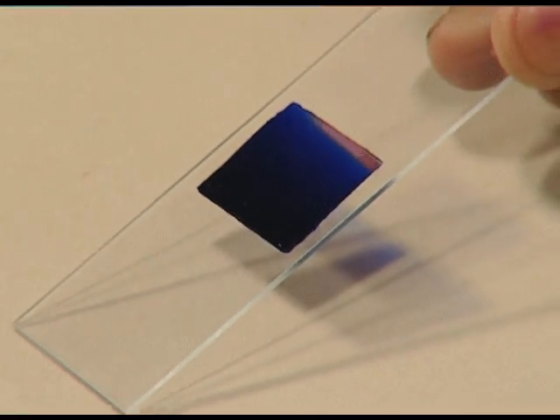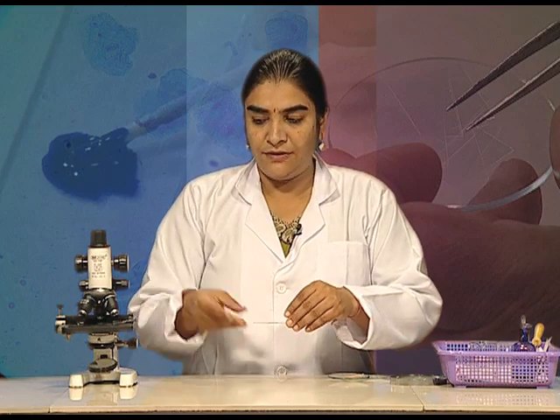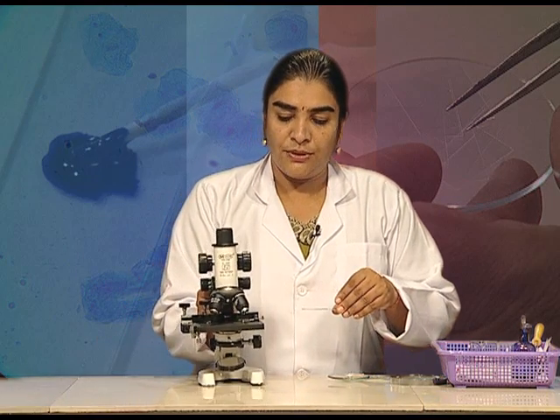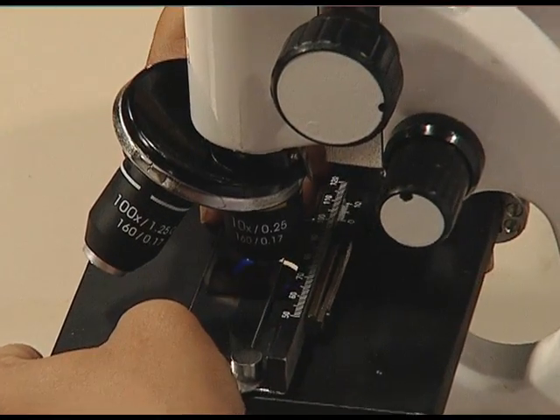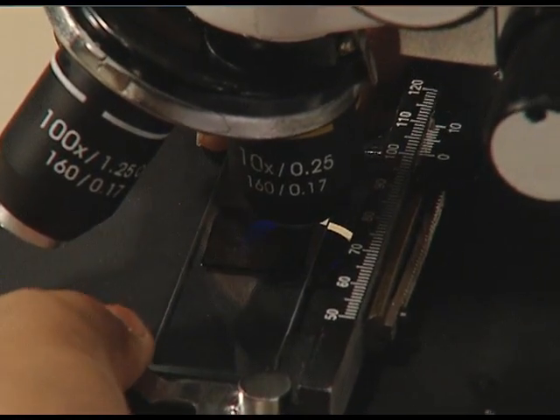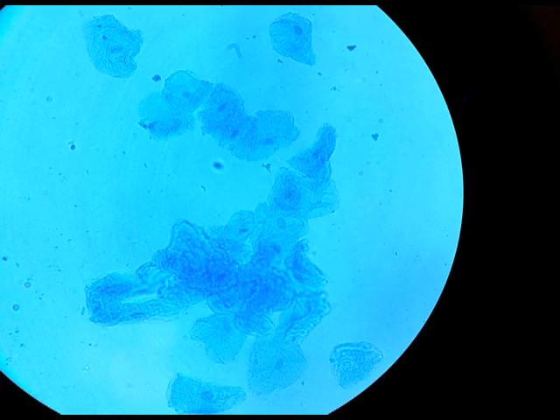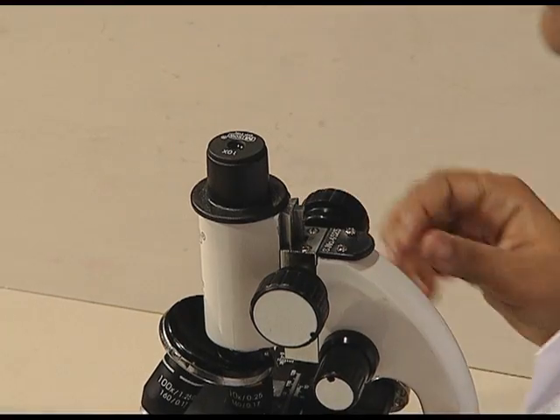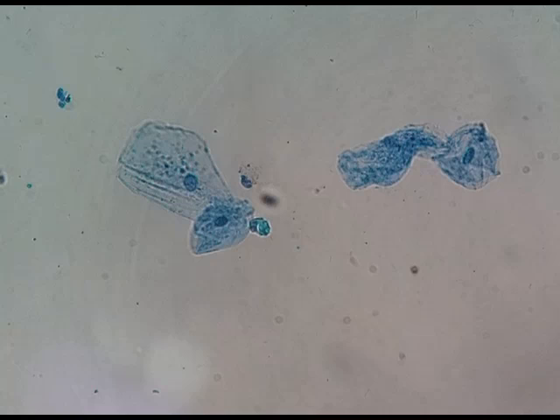The slide with cheek epithelium cells is ready. Now we will be observing it under the compound microscope. Take the microscope, place the slide on the stage, fix the slide, and observe it under low power. When we study the slide of cheek epithelial cells, we observe that the cells are irregular in shape and are stained blue in colour.